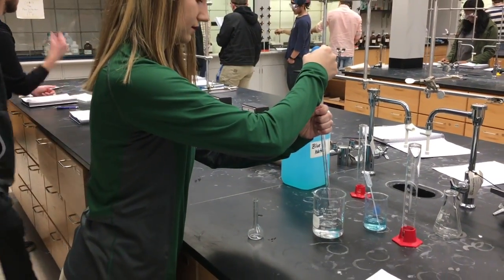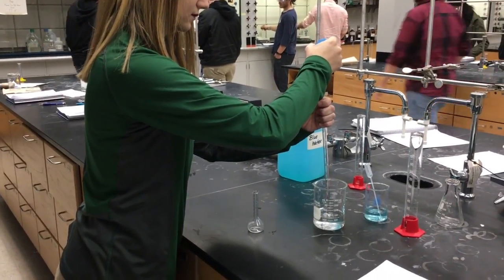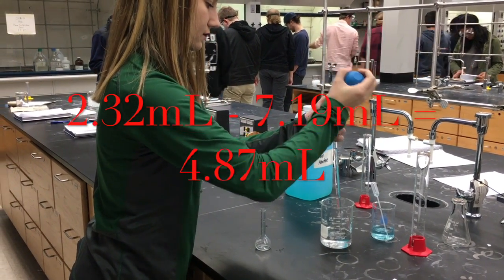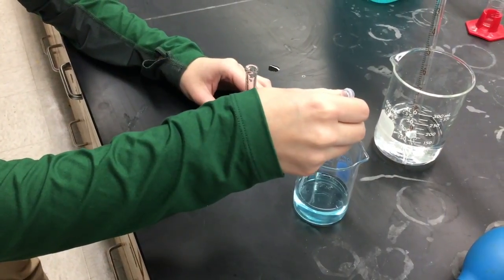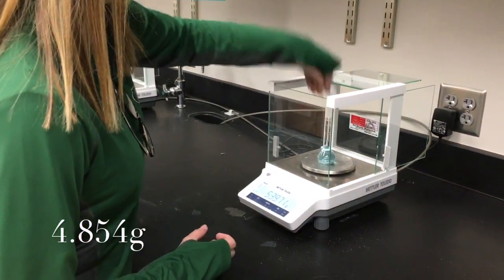For challenge 3, we will be trying to determine the concentration of an unknown solution by comparing the data from this trial to the 3 trials in challenge 2. The unknown solution we will be using is unknown number 943. We will do the exact same procedure we previously did with the 20% stock solution with this unknown solution.